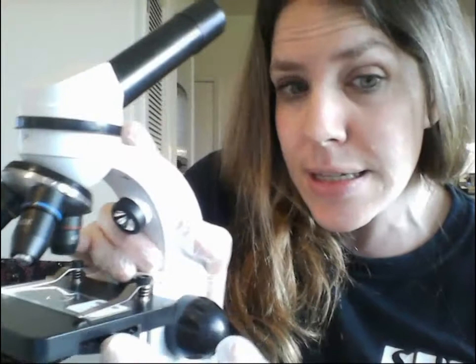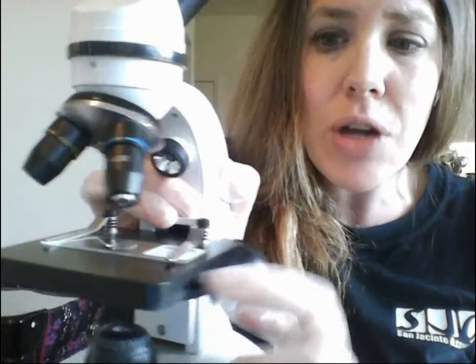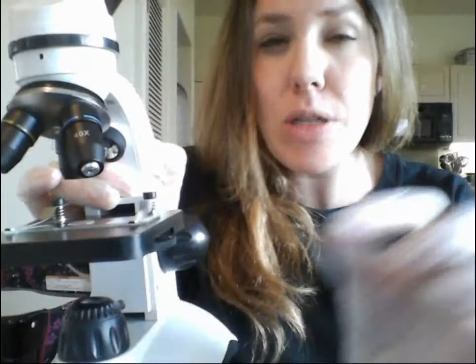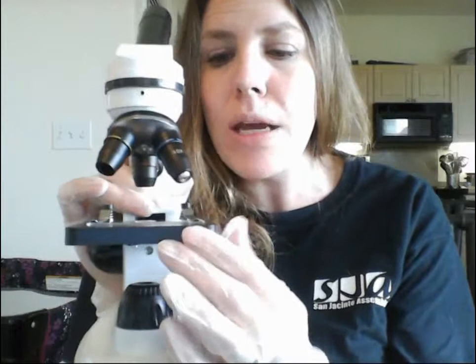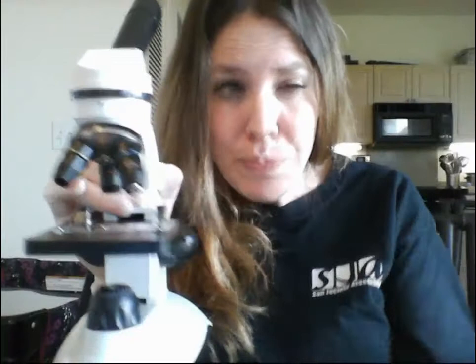On your left when looking from the back through the ocular is a sliding disc called the iris diaphragm. It has a lot of little holes with numbered settings, and as you turn it you get different size holes. The smaller the hole, the less light from the bottom shines through the specimen. You probably want fairly larger holes at low magnification, but at the highest magnification you want that hole nice and small so you don't have a lot of ambient light — just focused light through the specimen.